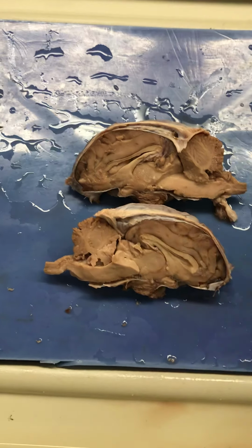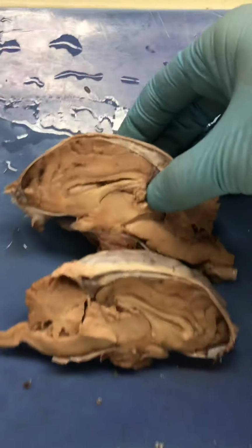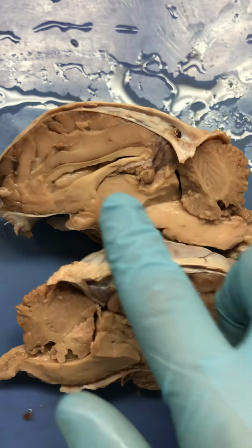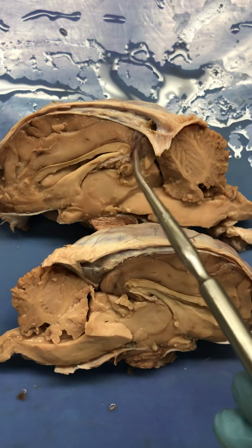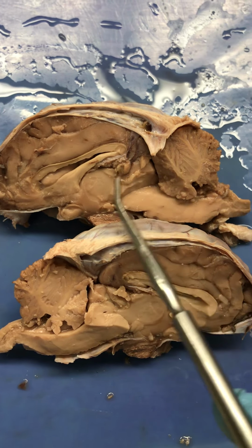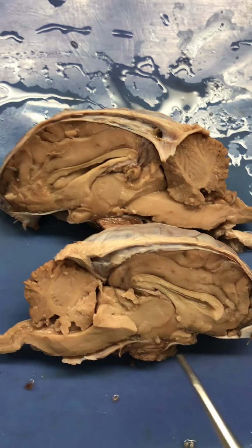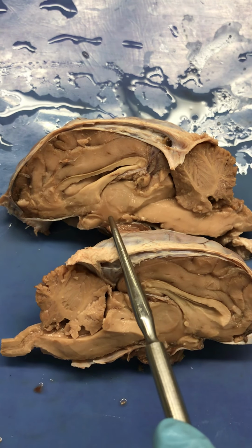On this side right here, this is good. I've got the epithalamus intact still. It's also called the pineal gland because it looks like a little pine cone. Sorry, I'm shaking. So that's the pineal gland there, or the epithalamus, and it's called the epithalamus because it sits above the thalamus, okay? I hope you can see that right there. That's your pineal gland, a very, very delicate structure. I had removed it from there. It went with this side of the brain, the right side of the brain. So thalamus, epithalamus, and that's where your epithalamus would be. Down here, beneath the thalamus, is the hypothalamus, okay?